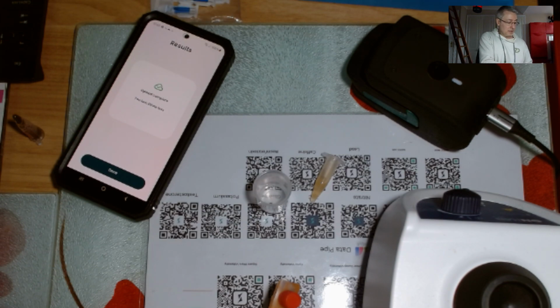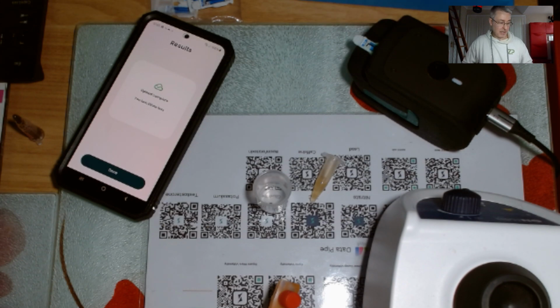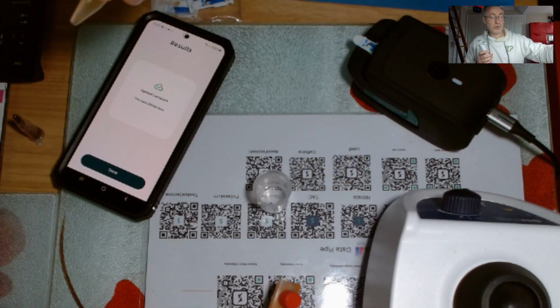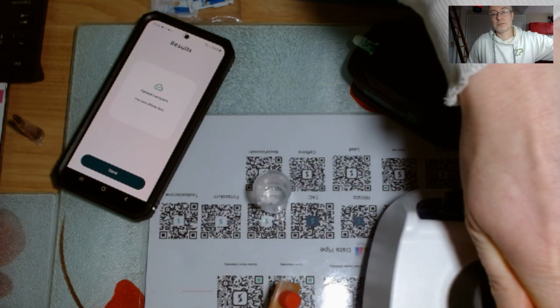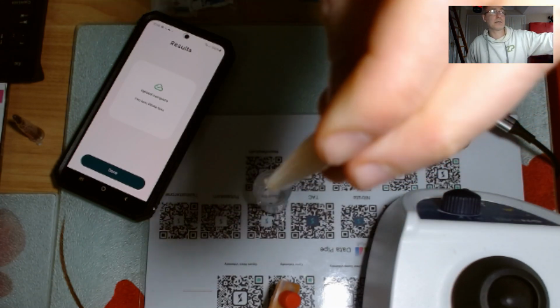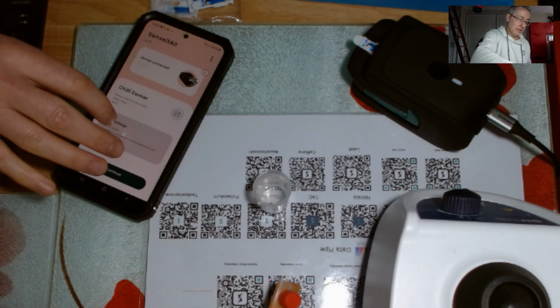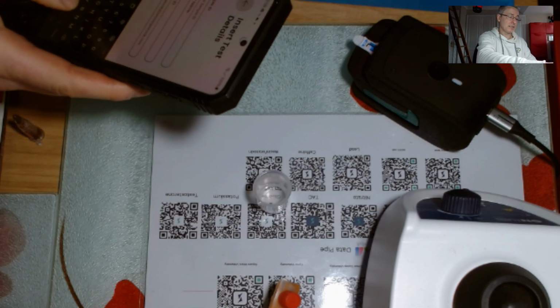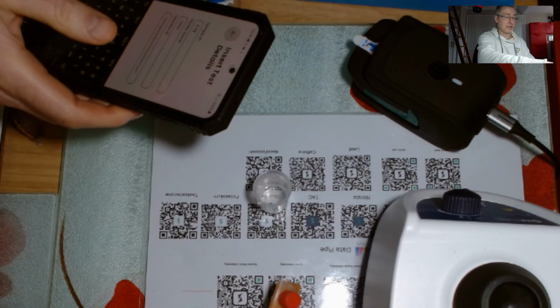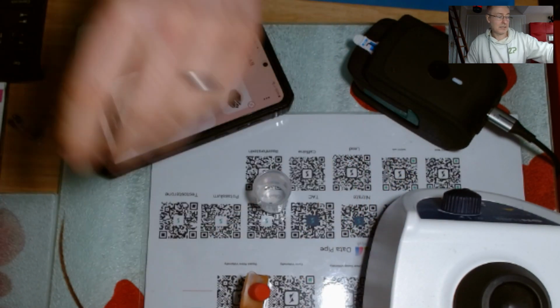So let's move forward. Let's put the sensor on. Let's close it up. And what I'm now going to do is put the sample actually on. I'm just going to vortex the sample. I'm vortexing it because these kind of samples can end up settling. They're quite heterogeneous, so I'm just homogenizing it. I'm actually going to call this B10. B because I've labeled the sample that, and 10 because that's the dilution that I'm using. So I've just labeled that B10, so I can identify that later on.